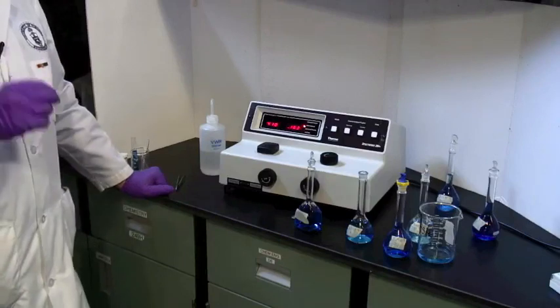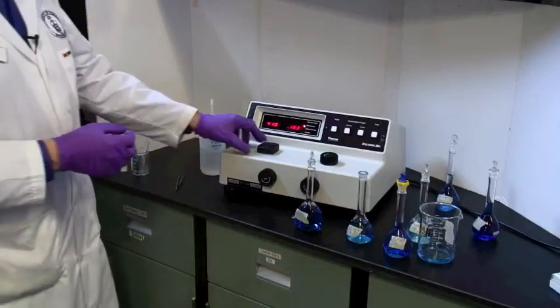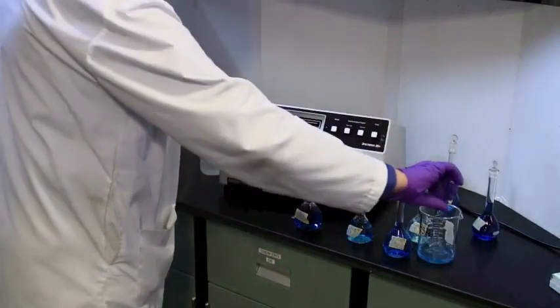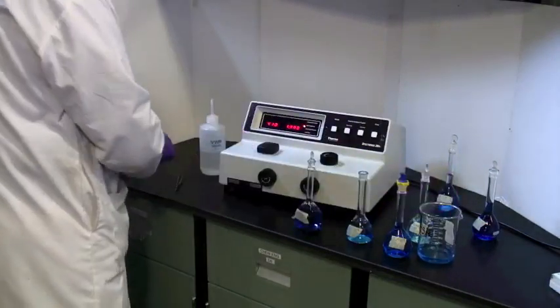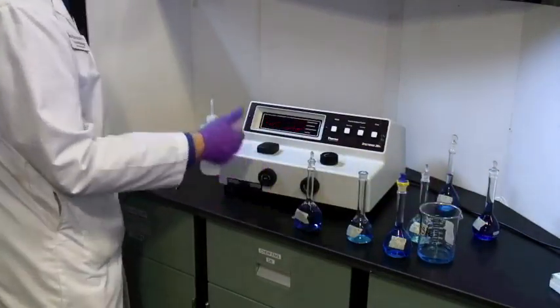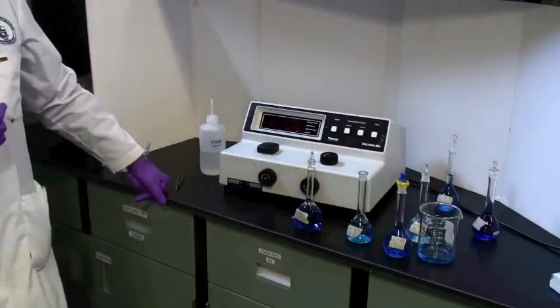Now, once you've read all of your solutions, remove the cuvette, dump it off, wash it all out, turn the Spectronic 20 off, unplug it, and return it.